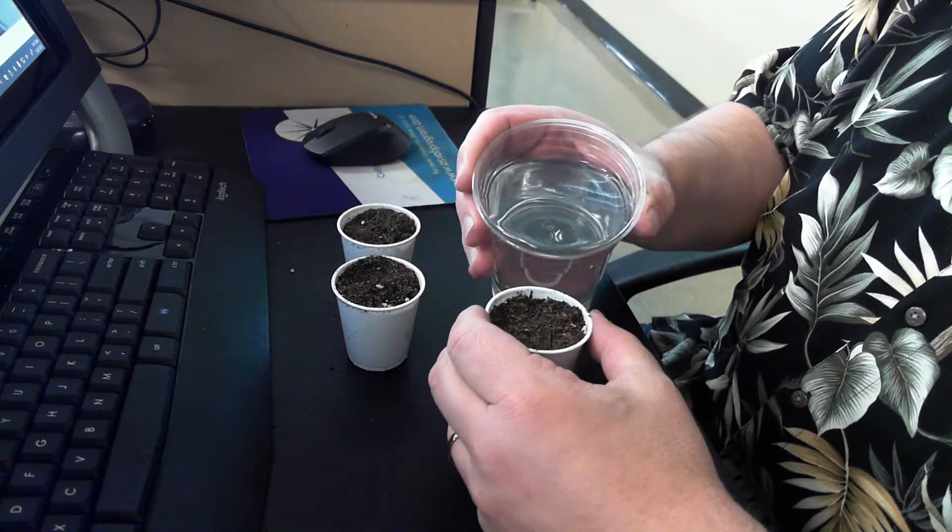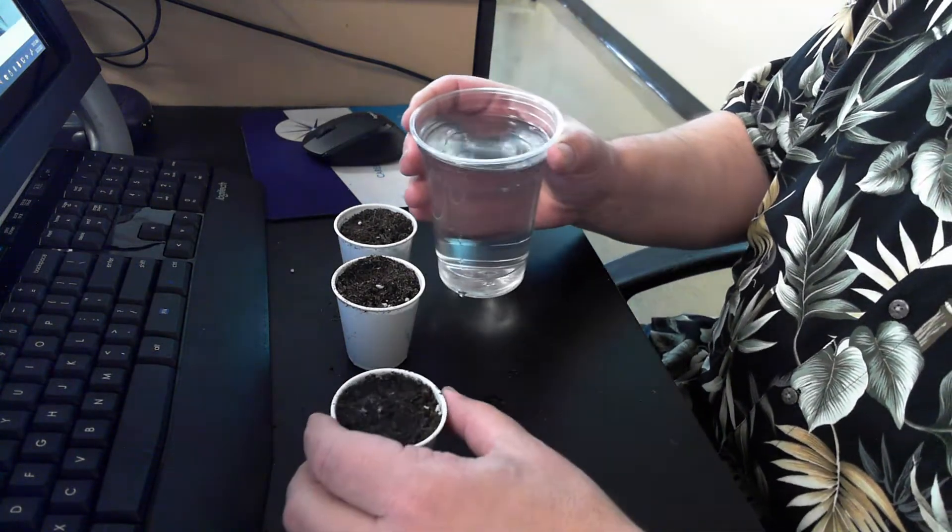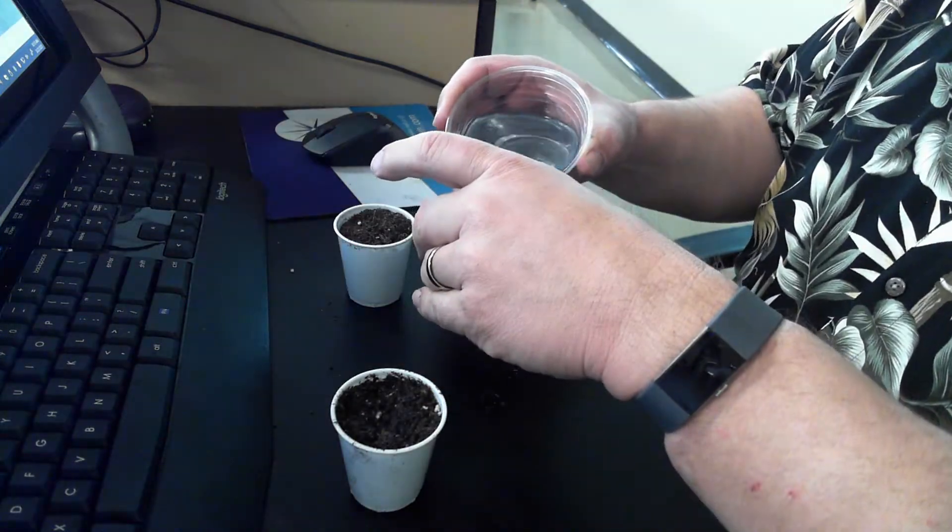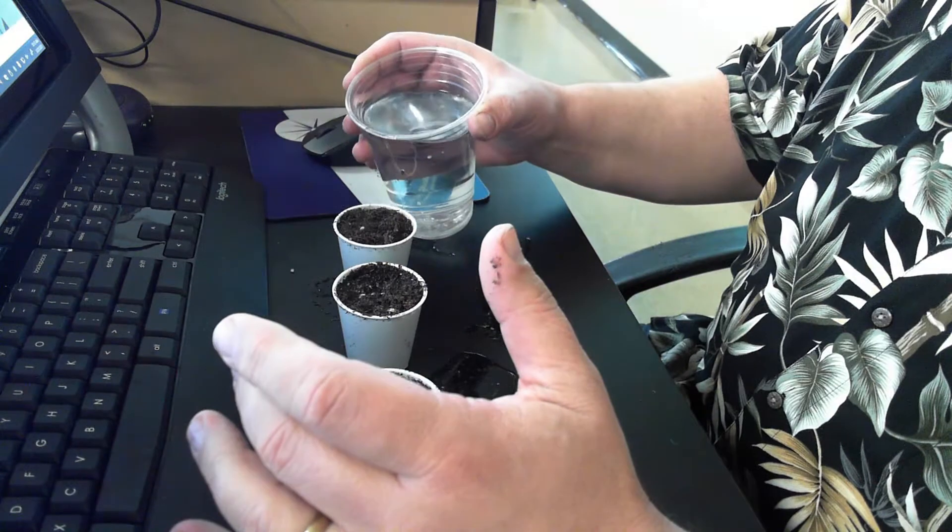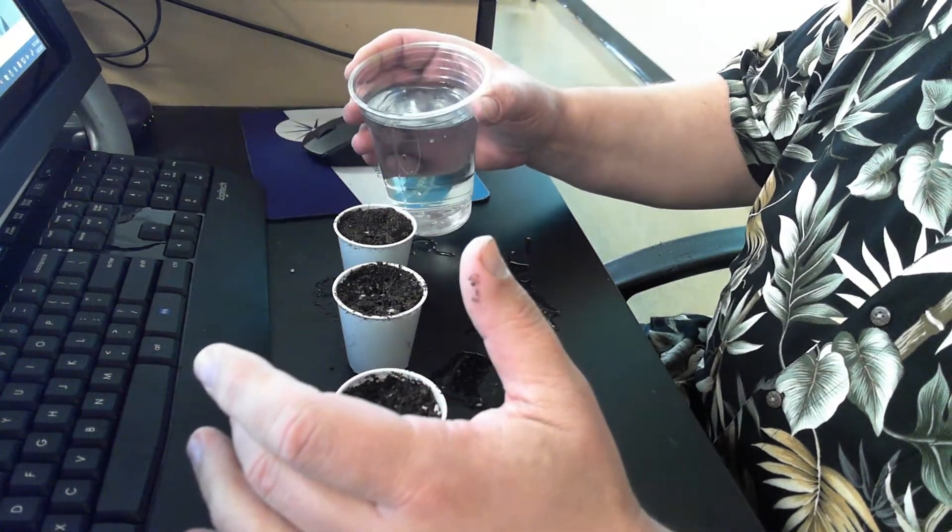So, a little bit at a time. Give it a chance to soak down in. Keep some paper towels handy in case you overfill.